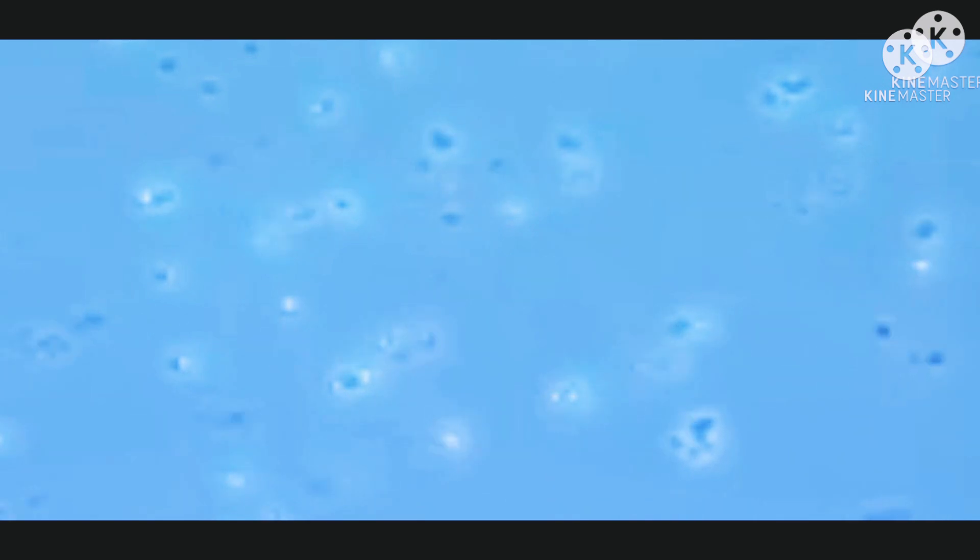Passive drifting is the movement of bacteria in the same direction as the flow of water. This is usually seen in a wet film — just watch for some time and you will see all the bacteria and some cells moving in the same direction as the flow of water. This passive drifting can also be mistaken for bacterial motility activity.